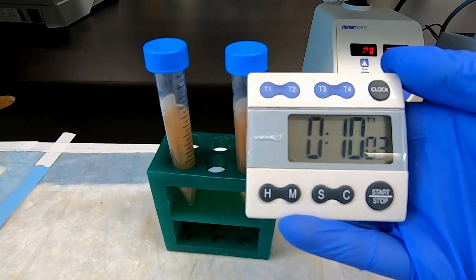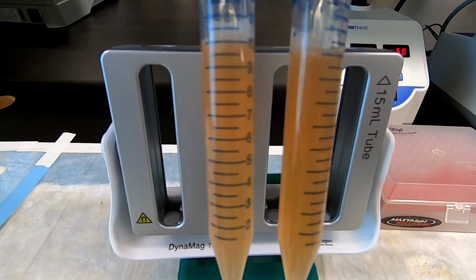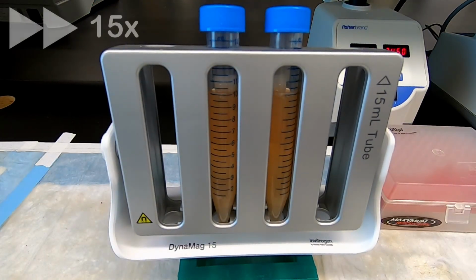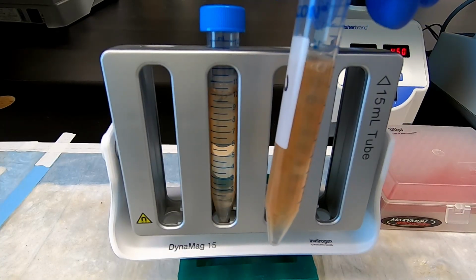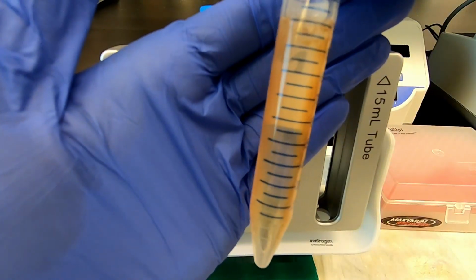After the incubation, place tubes on a magnet rack to separate the now RNA-bound beads from the liquid sample. It usually takes 1 to 3 minutes for the magnetic beads to fully separate. The solution should become clear again, and the beads should accumulate up the sides of the tube.